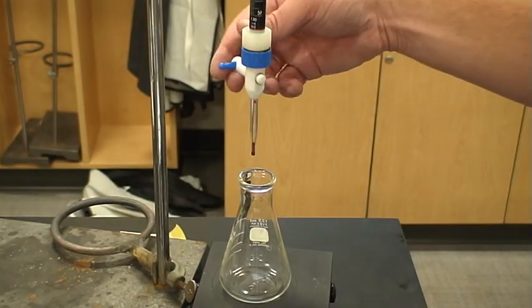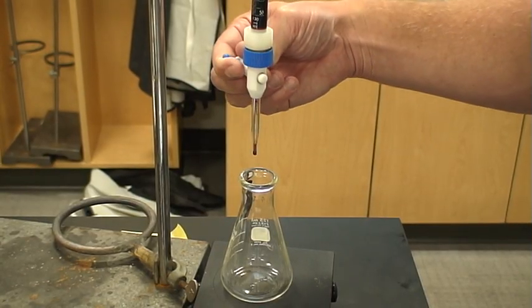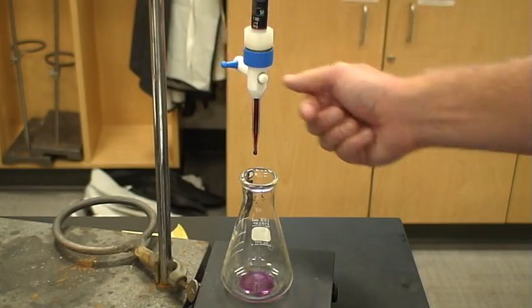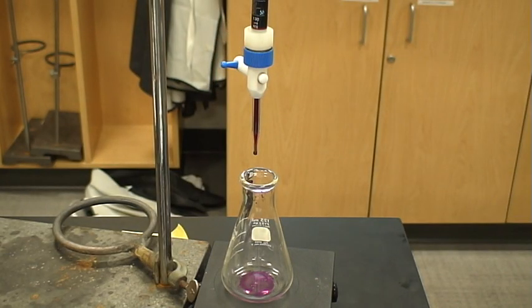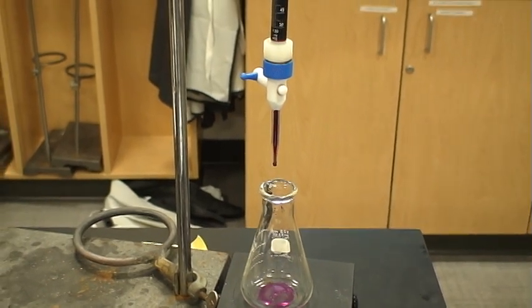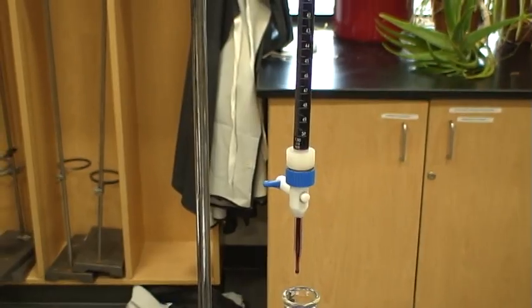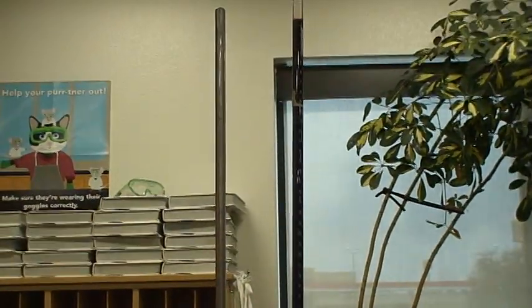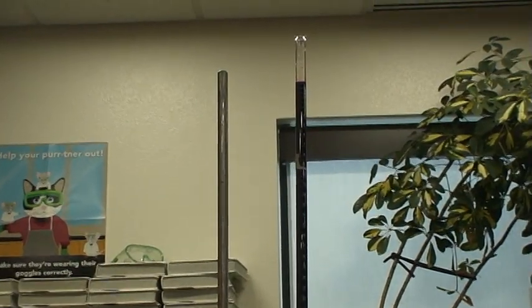And so this waste container will just hold a little bit extra of my permanganate, so that now it's actually down to the tip. And so I look up to the top of my burette and I see I have to record exactly how much I started with. Okay? I have to record exactly how much I started with because it's not always going to start at 0. So this is very important to get that starting volume.